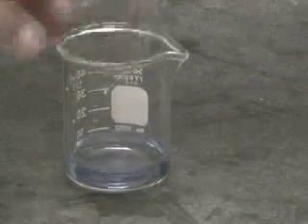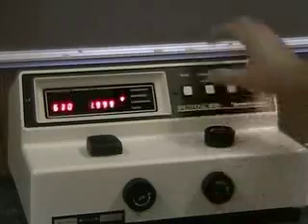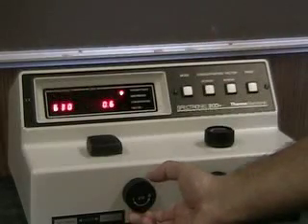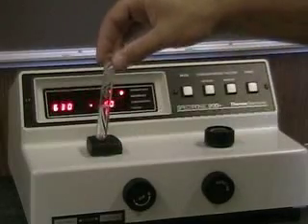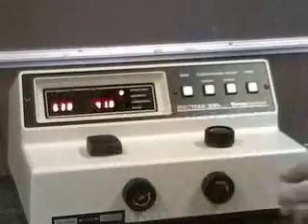and add ammonia. The ammonia forms a tetraamine complex with the copper 2+ ion to form the blue color. We are going to test for the amount of copper sulfate using a spectrophotometer. We will test at a wavelength of 630 nanometers. Before making our readings, we must zero the machine. With no cuvette in the holder, we set the transmission to 0 because the light is not on. With a blank cuvette in the holder, we set the transmission to 100 as all the light should go through.